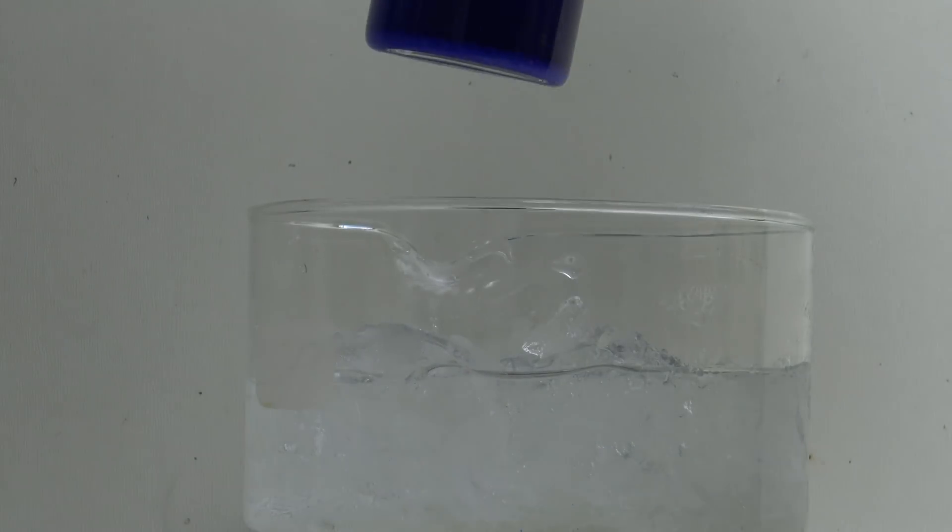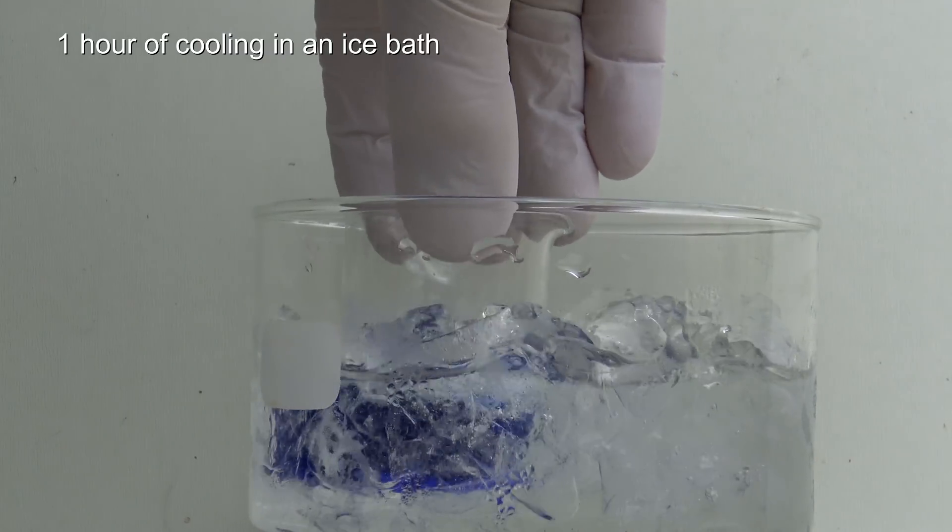Next, the solution was cooled in an ice bath for one hour to increase the amount of precipitate.